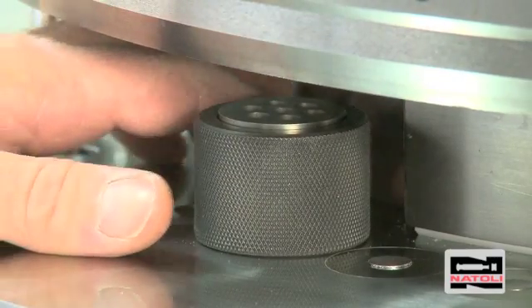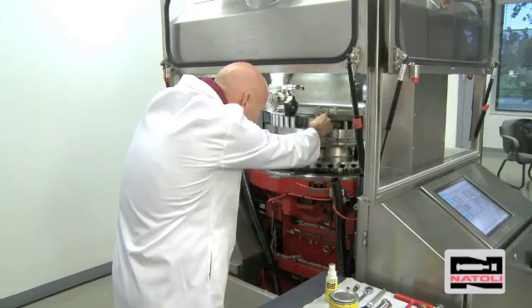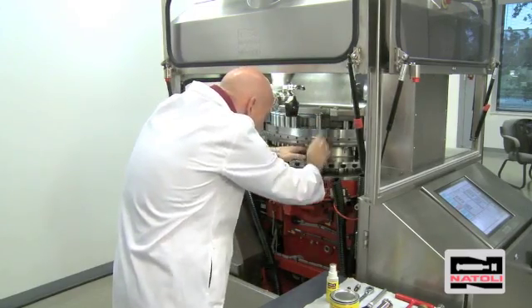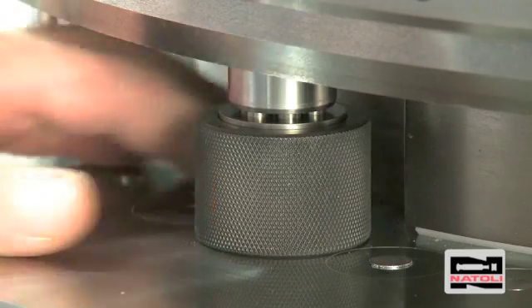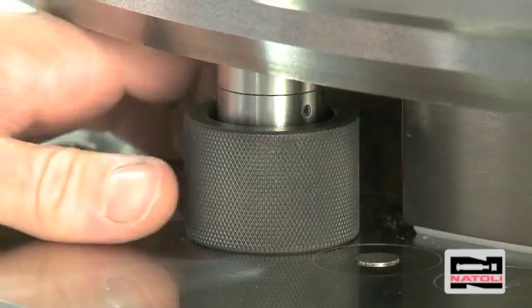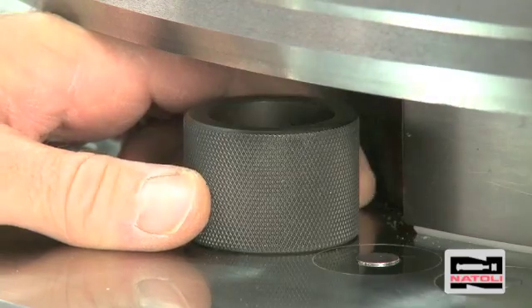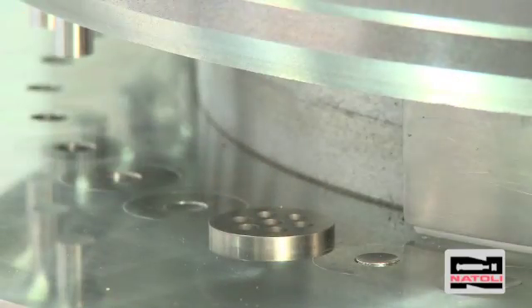Because this is multi-tip tooling, you need to be certain the punch and die are aligned perfectly. Use the upper punch to align the die — with the upper punch being keyed, you use a clockwise force to preload the punch. When the punch tips are inserted into the die bore, you will know it is completely aligned.